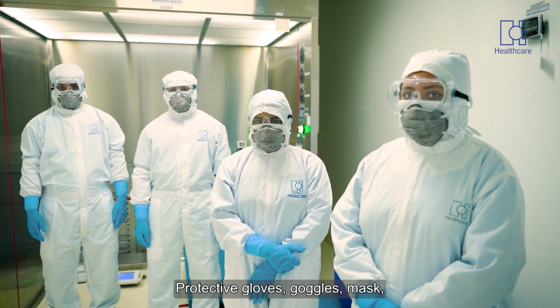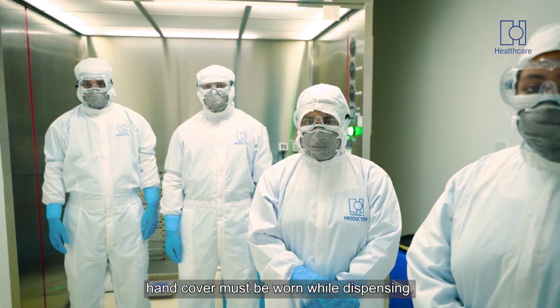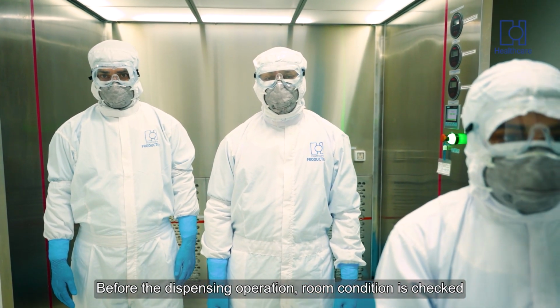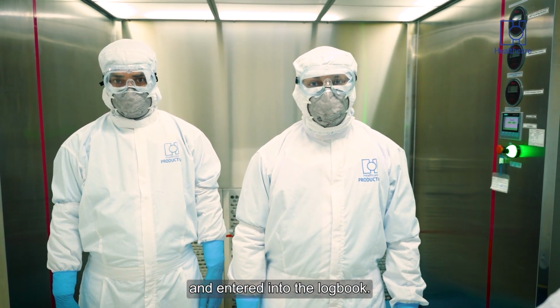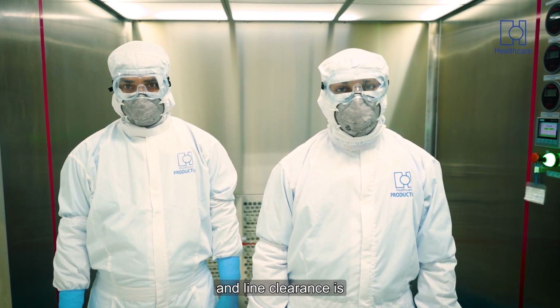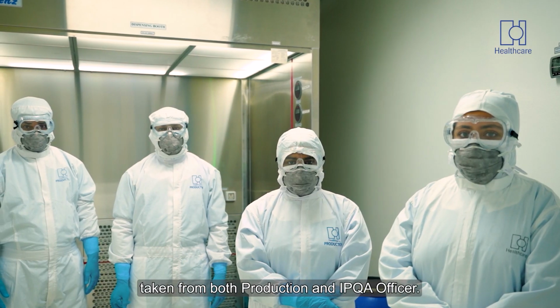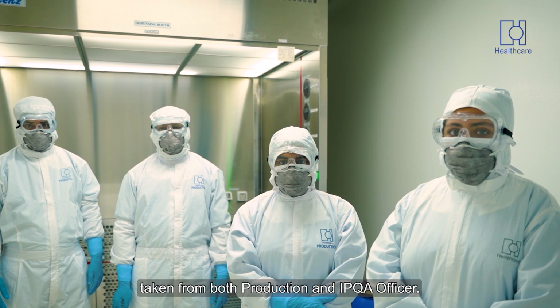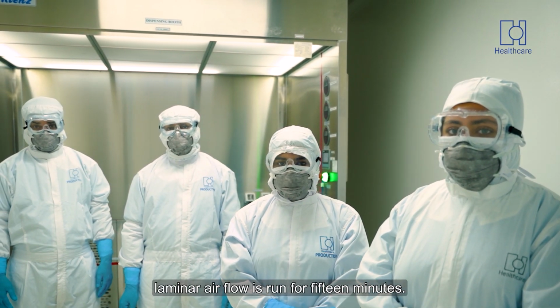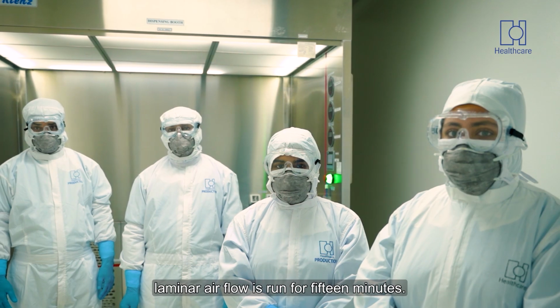Protective gloves, goggles, mask and hand cover must be worn while dispensing. Before the dispensing operation, room condition is checked and entered into the logbook. The balance function check is performed and line clearance is taken from both production and IPQA officer. Before starting the dispensing operation, laminar airflow is run for 15 minutes.